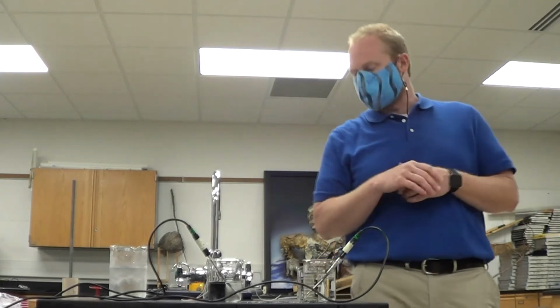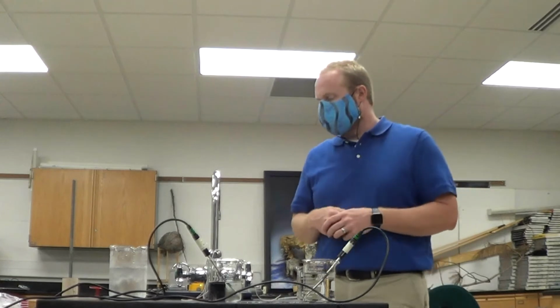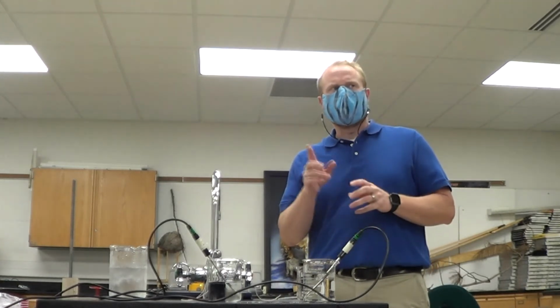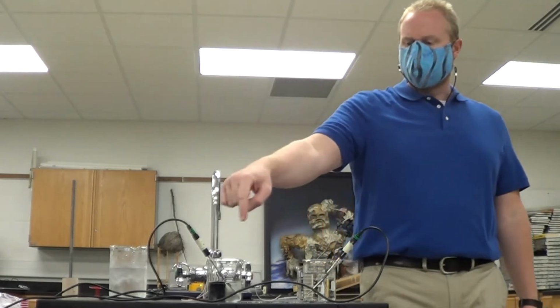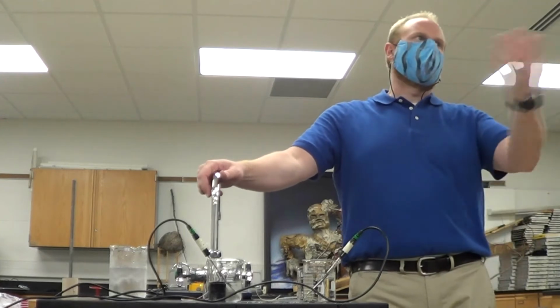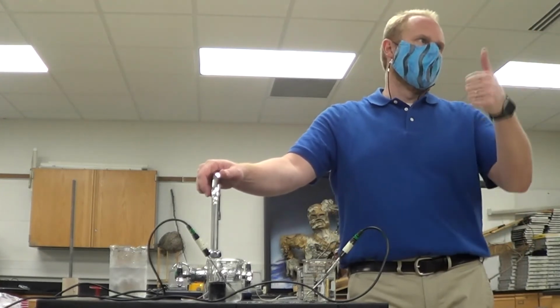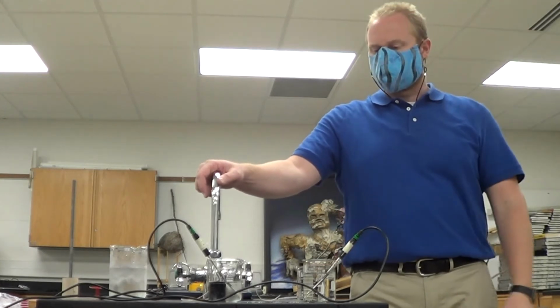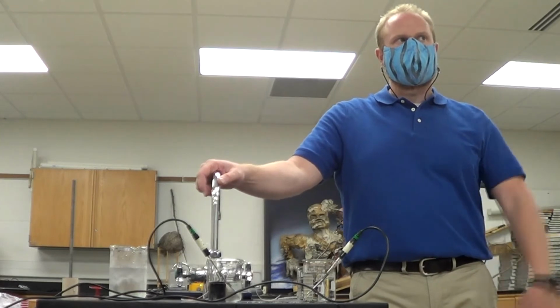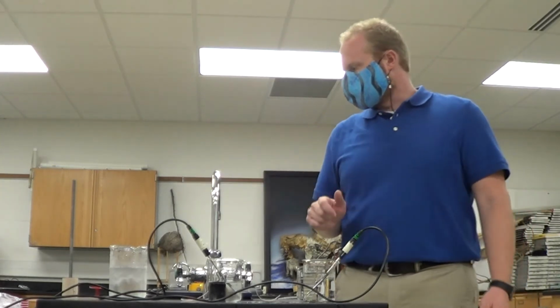Okay, so water has a high specific heat value, and 100 grams of hot water increased your starting temperature quite a bit more than the hot metal. Now, part of why this hot metal one is warming up a little bit too, now we're up to like 10.5, is that the room is about 20 some degrees Celsius. So just sitting at room temperature, it's going to warm up a little bit. Actually, that's probably more why it's ticking up right now. Okay, so that's station number 9.